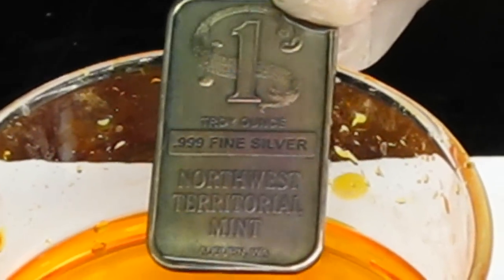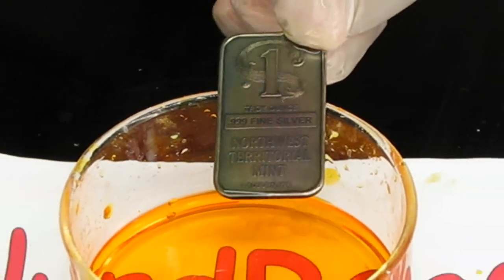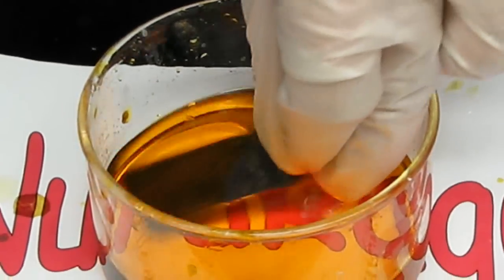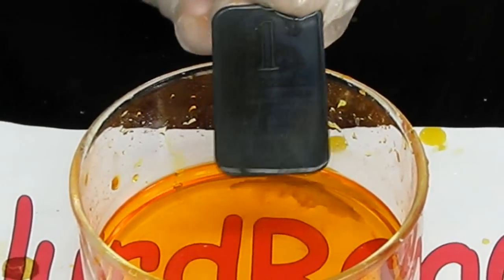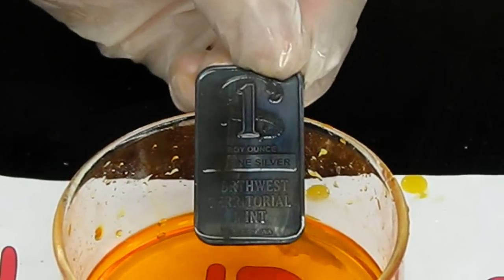Looks like we got some kind of dull gray color now. Another round? I'm not certain how to describe this one — a blue-purple color? Once we get this matte black color, further anodizing will no longer give us a color change.